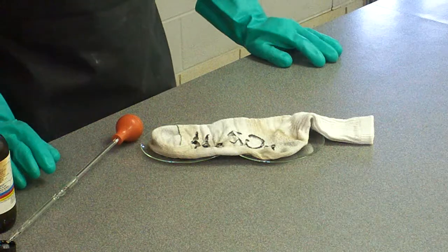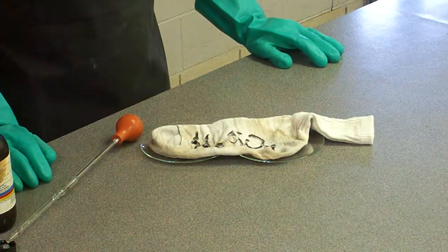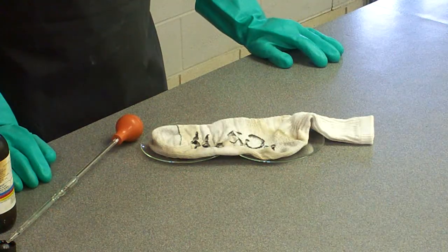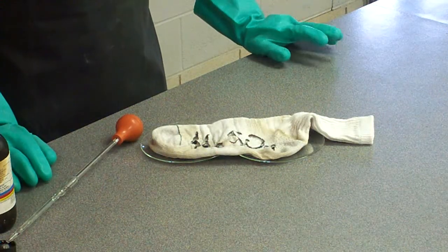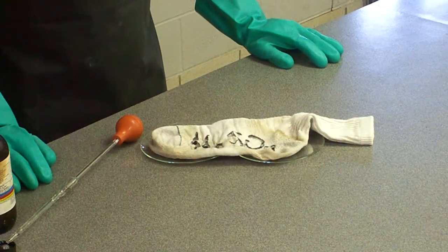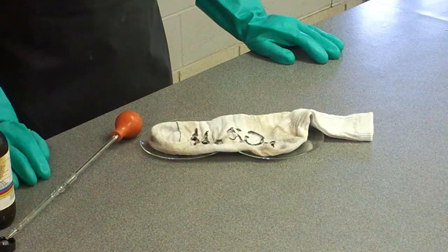Now imagine for a moment if this sock was on your foot, or if it happened to have been the sleeve of your shirt, the damage that it would have done. So again, the extreme importance of lab safety is one of the things that we cover at the beginning of the school year, and we stress it throughout the year every time we are in the chemistry laboratory.